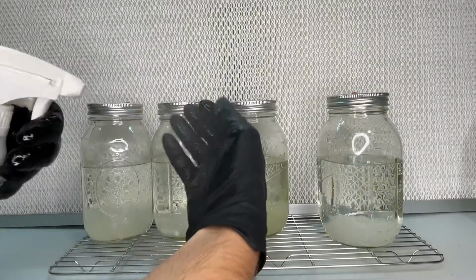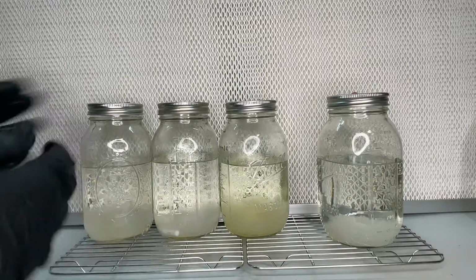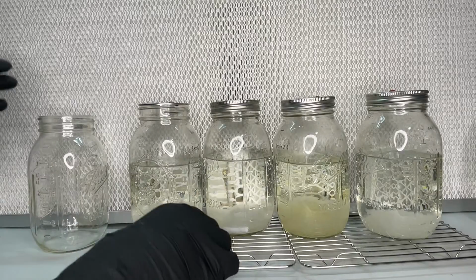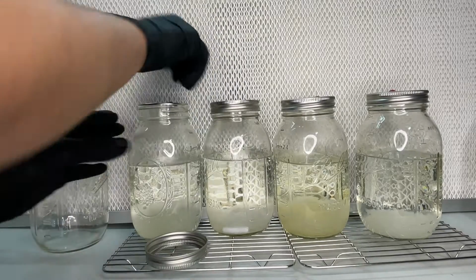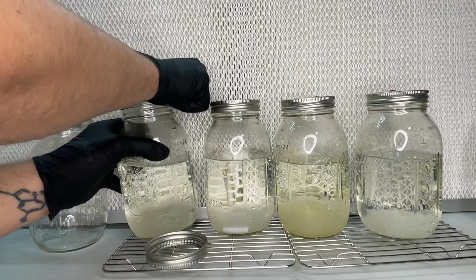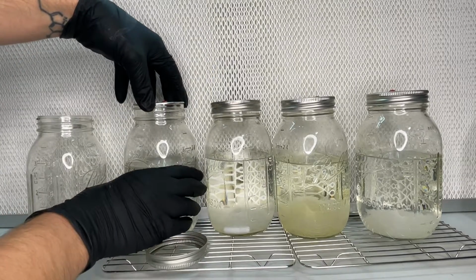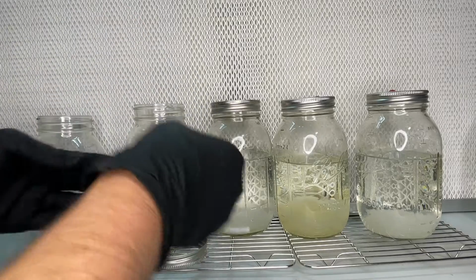The mycelium is not going to grow anymore in these jars because there's no nutrients, and it's going to be really hard getting the mycelium out of the jar because of the small amount of mycelium. The syringes would just have a little tiny bit of mycelium in them because it's diluted so much.